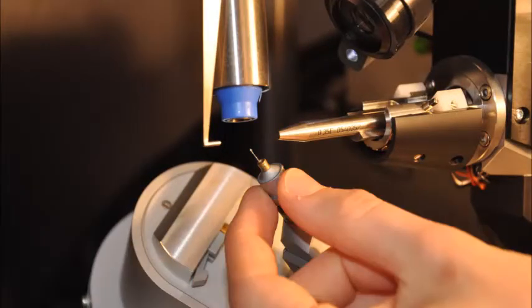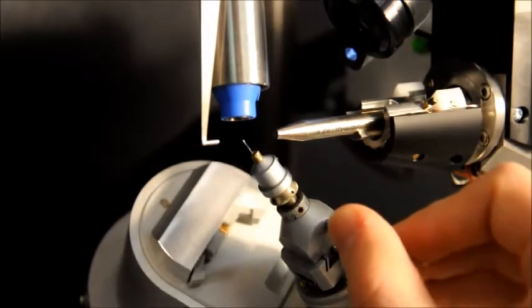Once done, mount the pin under nitrogen flow, in this case from the blue nozzle, and center the crystal in the X-ray beam.